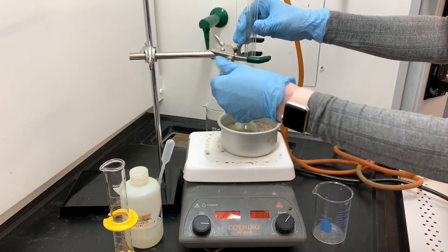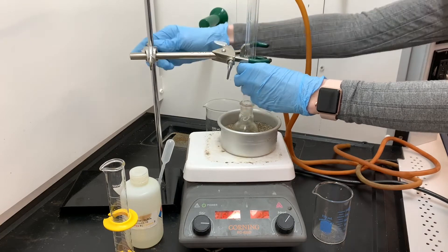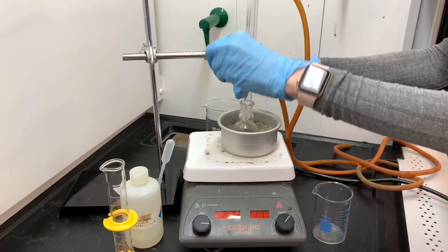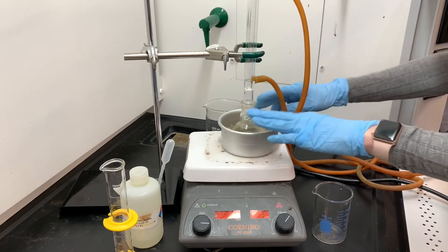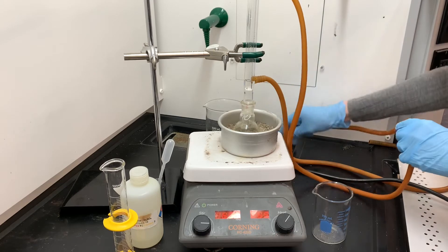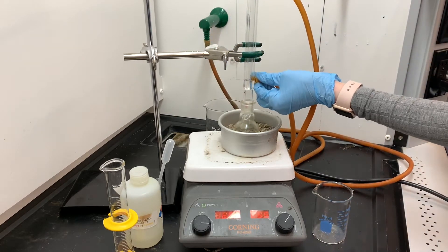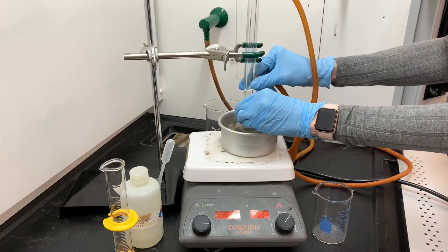This is just going to sit and heat under gentle reflux for about 35 minutes. I'm adding my water condenser, and once the water condenser is in place, I'll get the water flowing. Remember, the goal of this experiment is to predict the product of this reaction — think about what kinds of products might be formed when we mix a ketone such as carvone with an acid such as sulfuric acid. Water comes in through the bottom port and out through the top port. This will sit and cook for about 35 minutes.